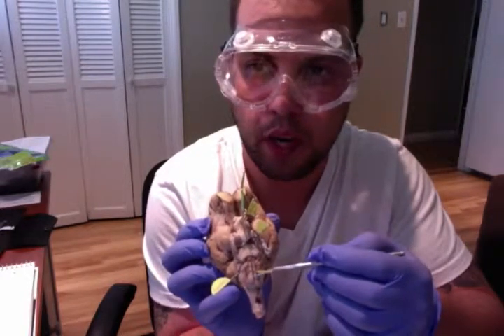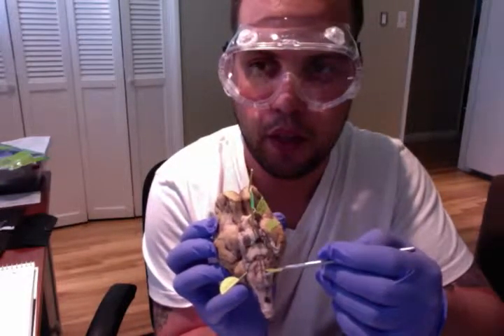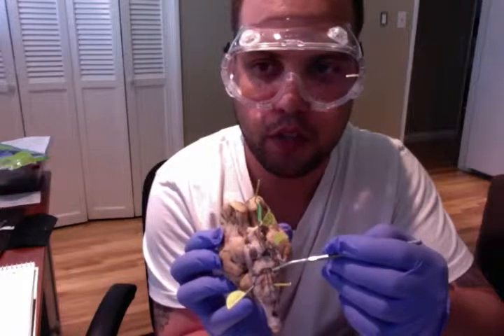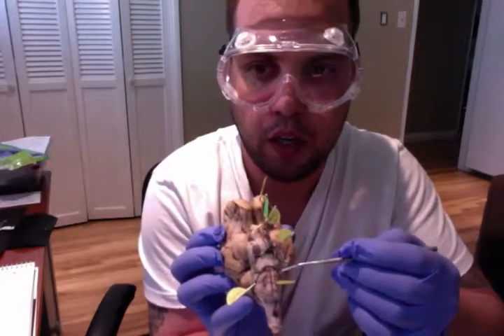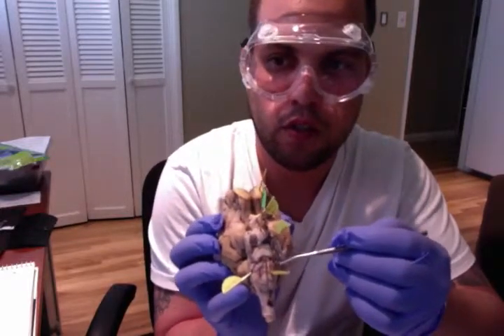The medulla oblongata is located in the brainstem anterior to the cerebellum. And the medulla oblongata is a cone-shaped mass in the hindbrain, controlling a number of automatic functions. Among other things, this section of the brain helps transfer messages to the spinal cord and the thalamus in the brain from the body, and controls breathing, heart function, blood vessel function, digestion, sneezing, and swallowing.